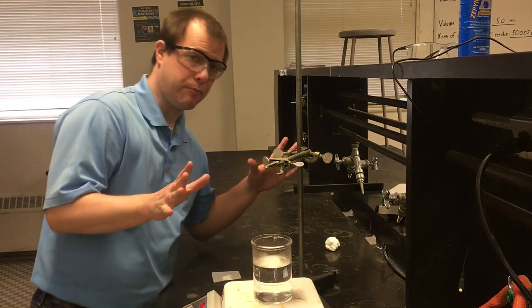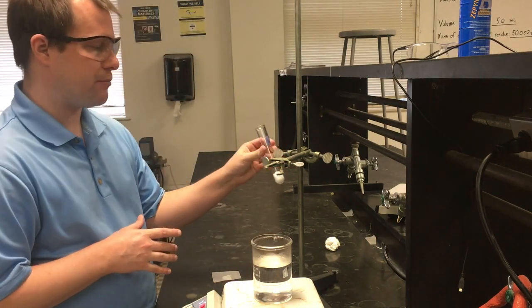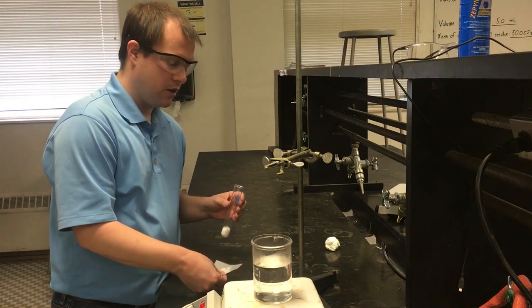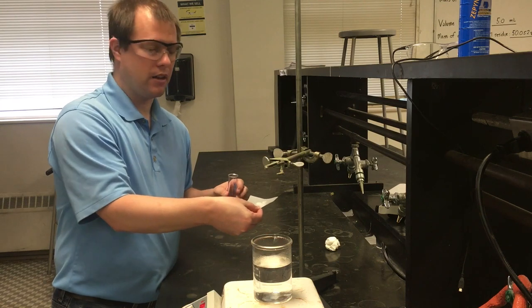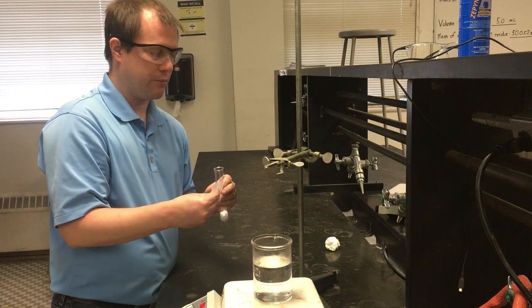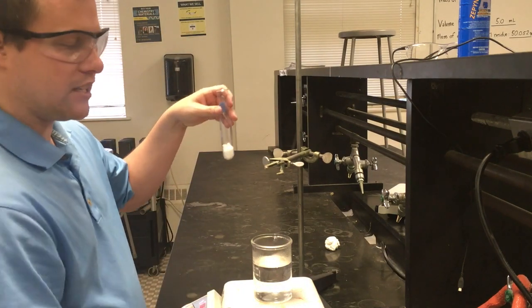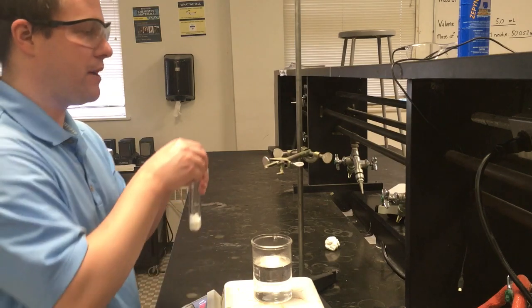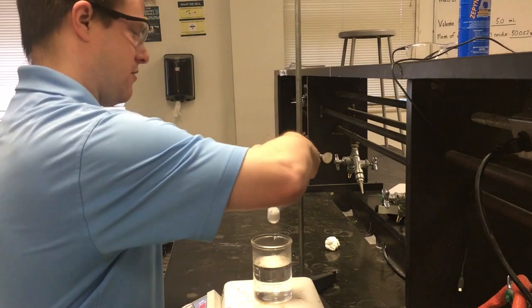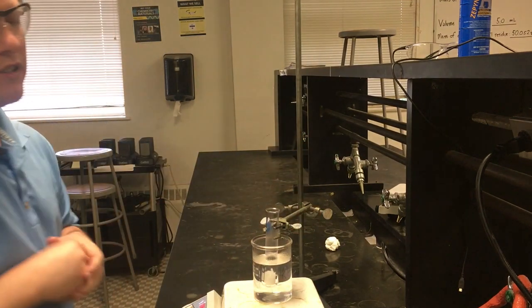All right, so I'm ready to set up part 3 of this experiment. For this last part, I have a whole fresh new sample of naphthalene. I've also massed out my unknown, which in this case is benzophenone, that I've already pre-massed out and am going to add to my sample. I'm going to take all of this again and melt it down in our hot water bath. Going to let this start melting.